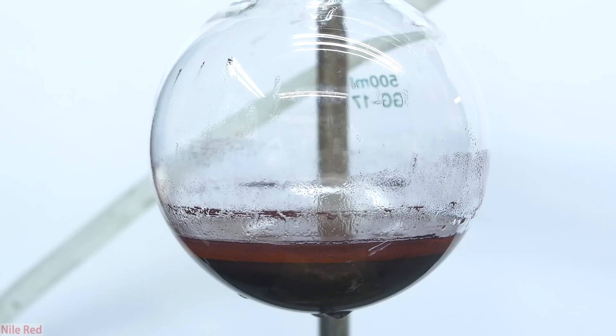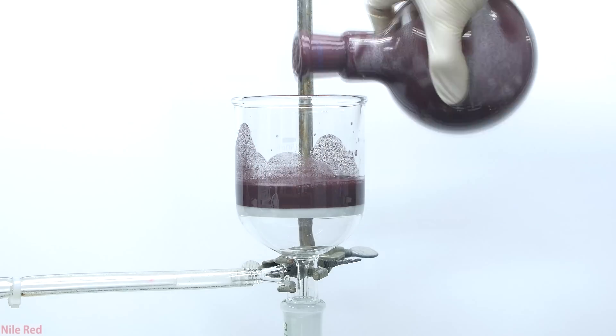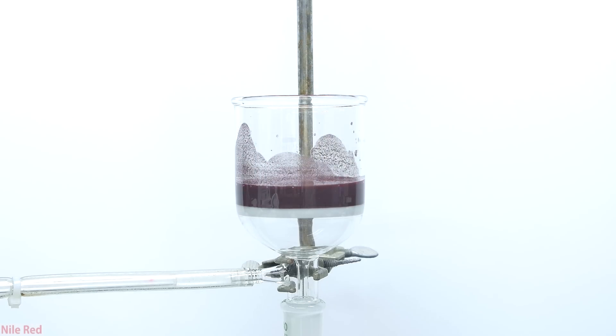If you recall from before, I mentioned that there's a lot of red phosphorus at the end of our distillation, and we can actually recover this. To recover it, it's actually pretty simple—all we need to do is just filter it off.